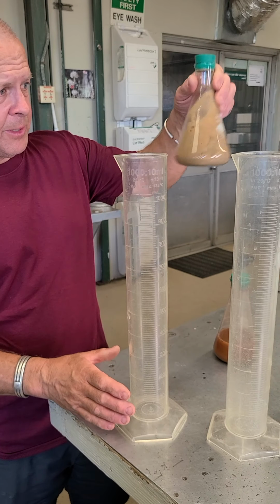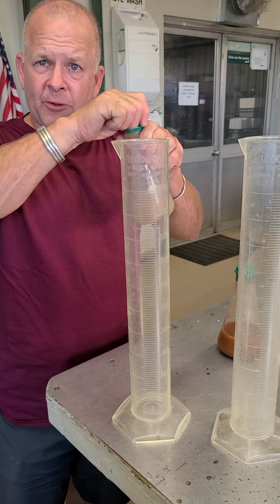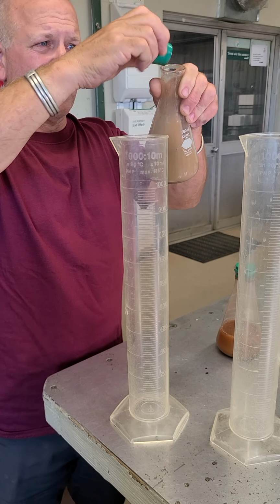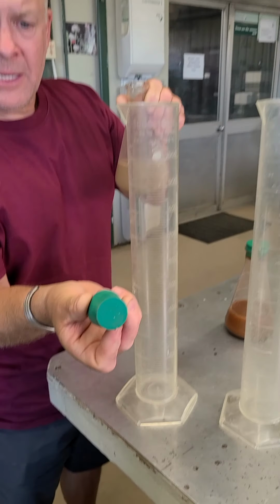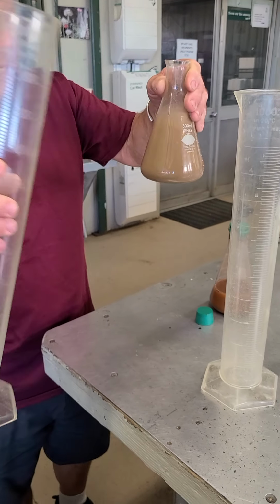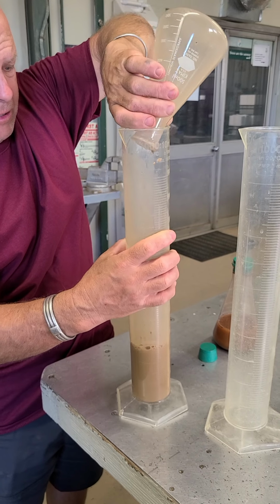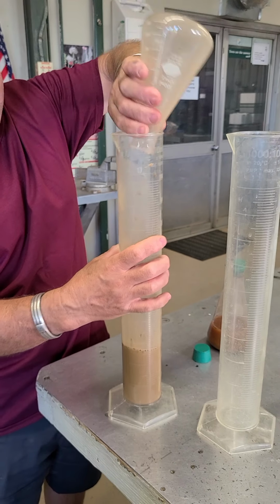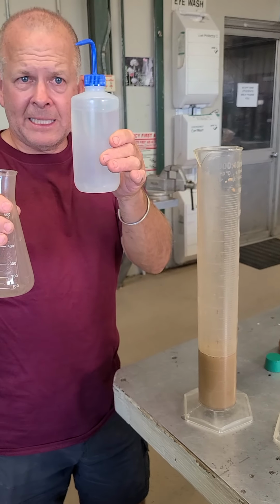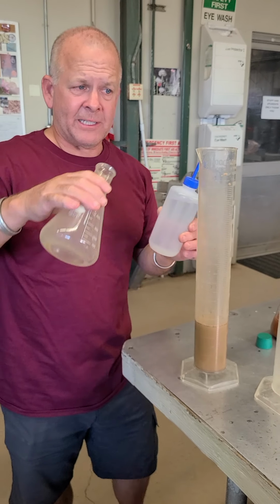Let's just take the first one here. I'm just going to shake it up because remember, we know exactly how much soil sample is in here. There's 40 grams of soil sample, if you remember. I'm going to try to wipe that off just a little bit. You can see it's pretty clean. It's just water in there. So now I'm going to carefully do this. I can pick this up in my hand, and I'm just going to pour it in, just like that. Try to get it all in there. And you can see that I didn't get it all in there yet because it's not clear in here. So I go ahead and take this. Remember, I can add as much water as I need until I get to exactly 1,000 mils.